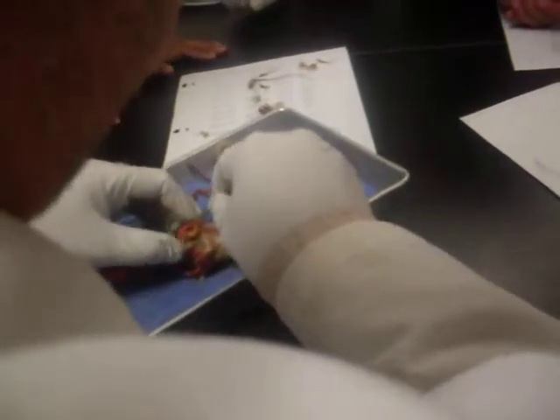Here's where this is kind of weird. If we look in here, see this attached right there? Everybody see that attached? That's the mandibular muscle — it's attached right there. Who was it that got the mandible and the mandibular muscle? Andrew, bring it over here really quick. See that? It looks like a little cone, and it's attached right to the mandible. Everybody see that?